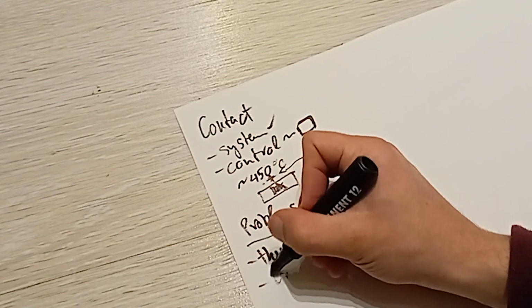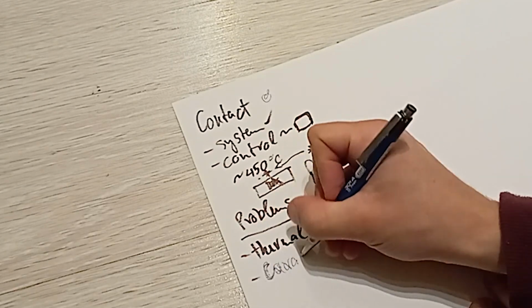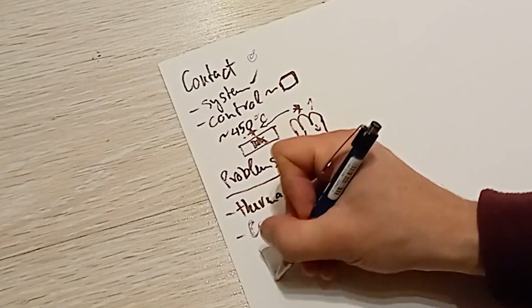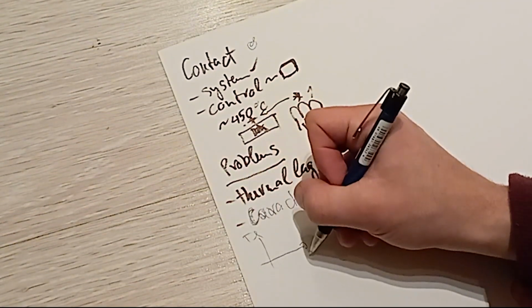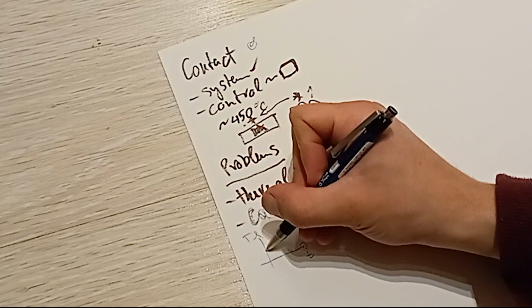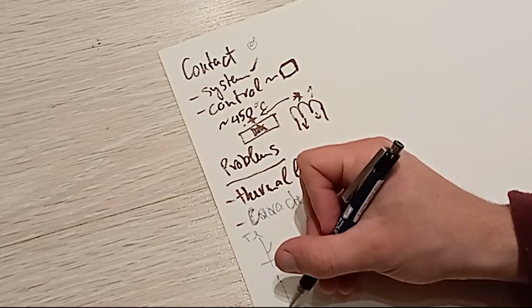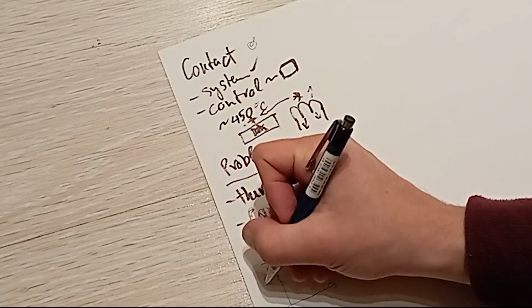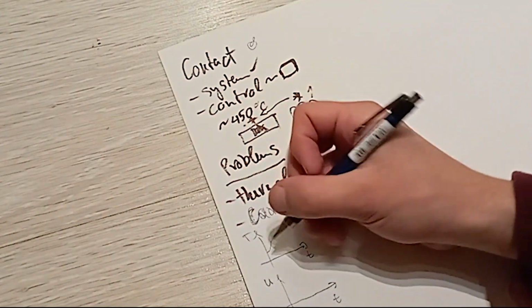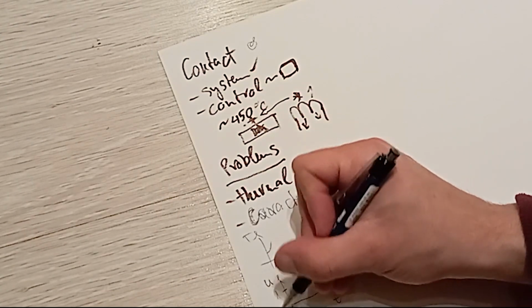Basically, I'm going to write here characteristic. Characteristic. So the system via temperature looks like this. This is temp. This is real time. And basically, as you heat it up, the temp goes up. You turn it off here. So I'm going to draw under it time and input. So this is here. This is on. This is off.